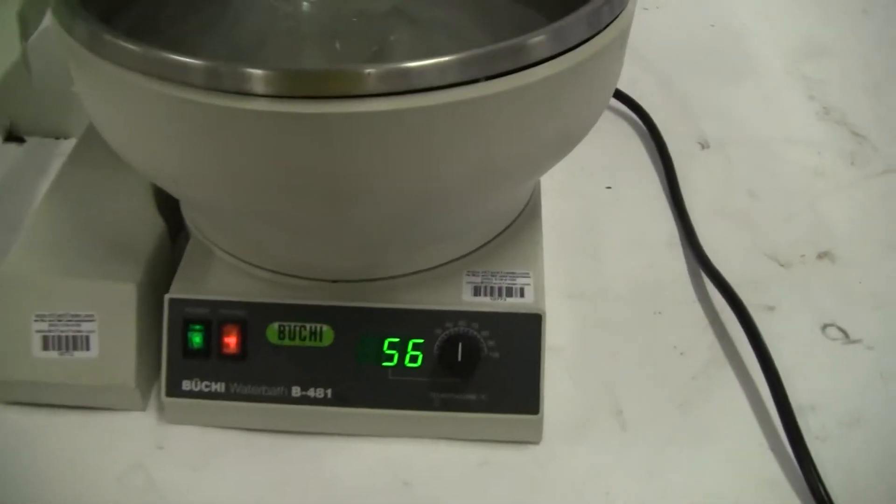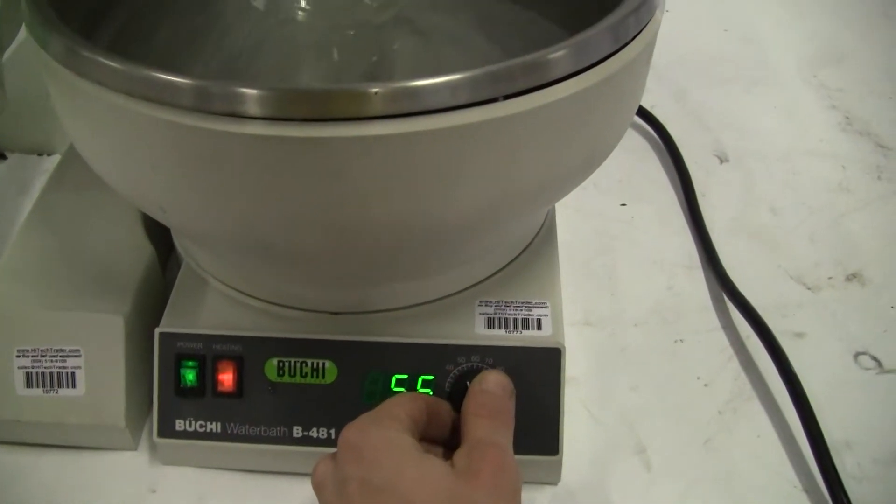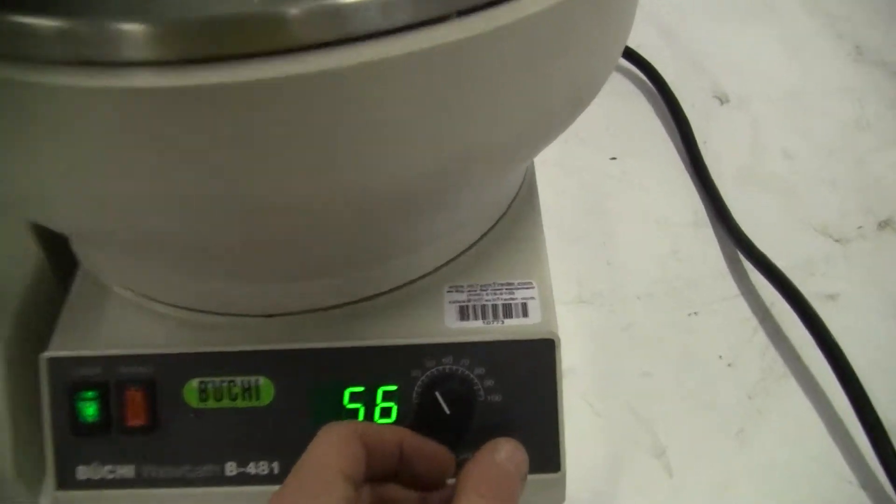You can see our digital temperature readout. We're calling for heat right now. Turn the thermostat down a little bit. There we go.